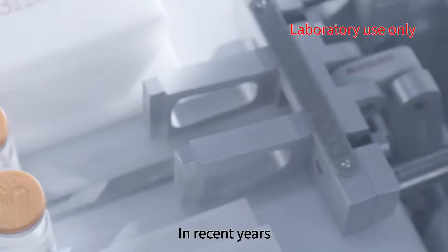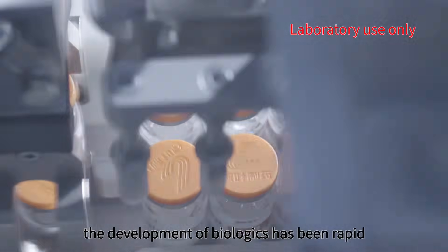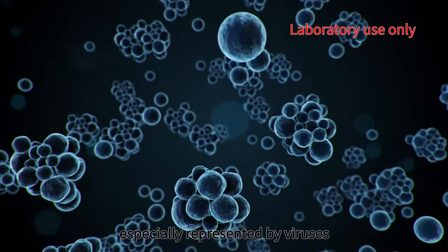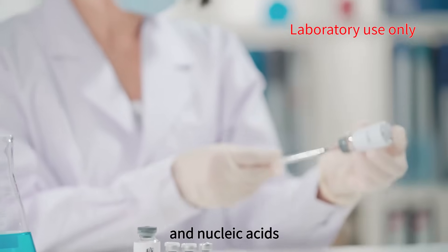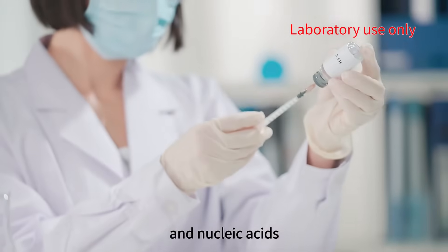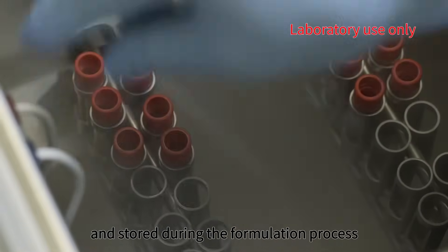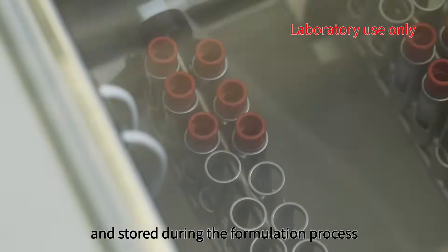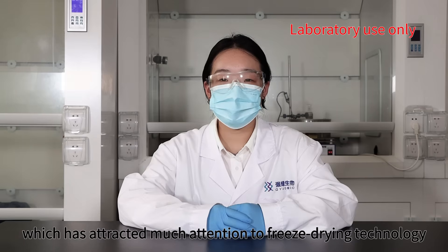In recent years, the development of biologics has been rapid, especially represented by viruses, vaccines, proteins, peptides, and nucleic acids. However, due to their thermal instability, they are often freeze-dried and stored during the formulation process, which has attracted much attention to freeze-drying technology.